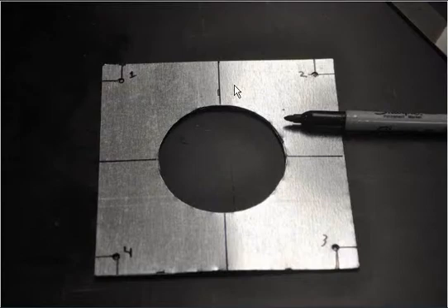Once we drill the mounting holes for the first plate, we're going to line up the two large 80 millimeter center holes together, and then mark the mounting holes in the corners through the holes we already drilled on the first plate.